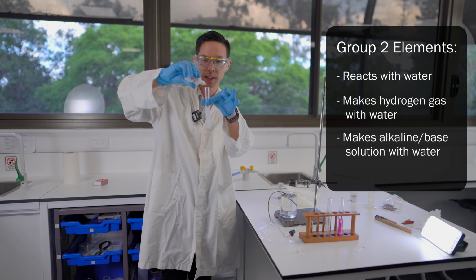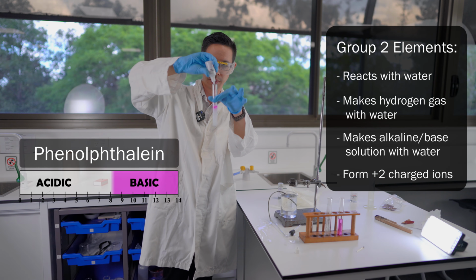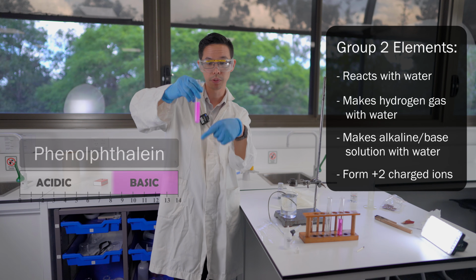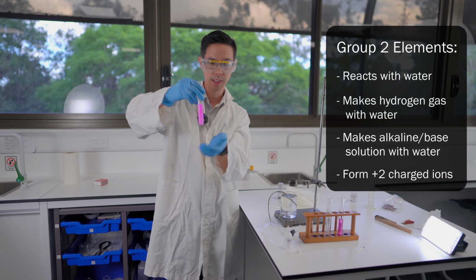If I add the phenolphthalein, I should see a much more intense pink this time because we've got far more hydroxide. Yeah, there we go. We've still got a bit of a milky appearance because it's creating very many micro bubbles of hydrogen gas, so it's still going.